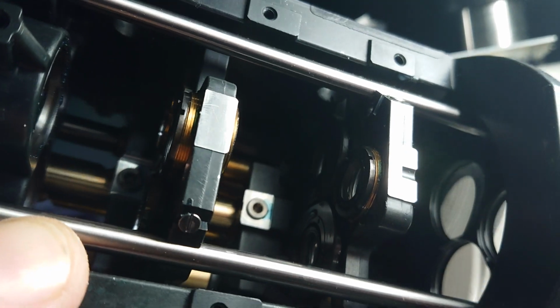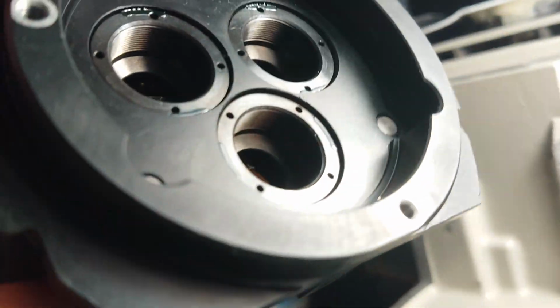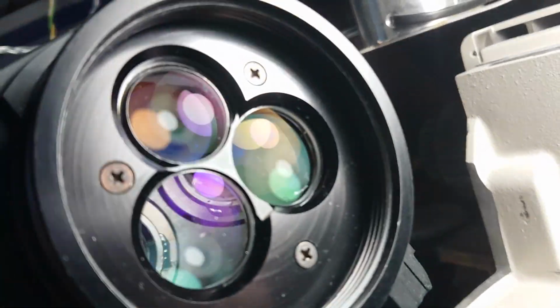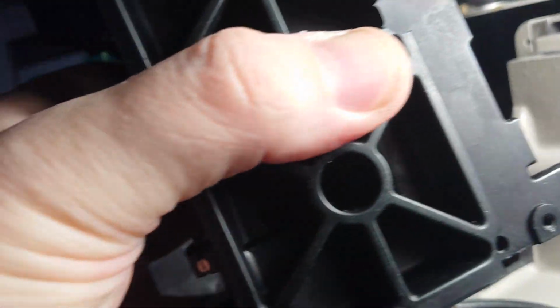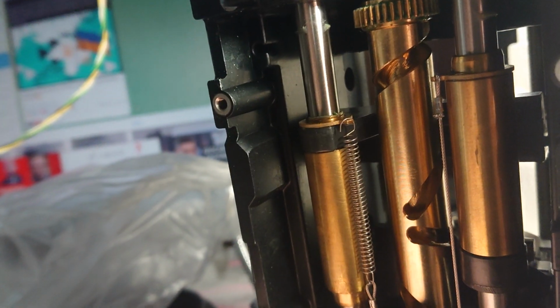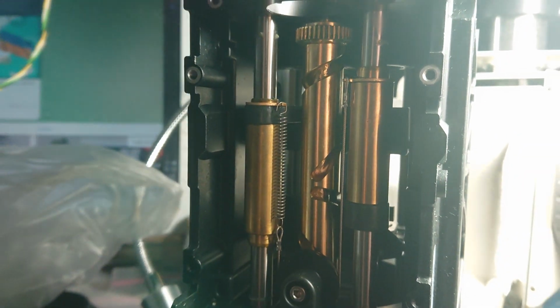Some brass barrels for holding glass. Very high quality coating. The best coating I've ever seen, I need to say. And mechanically, it's just very, very sturdy thing here. So let's try to find its real alignment, because I like the overall quality a lot.